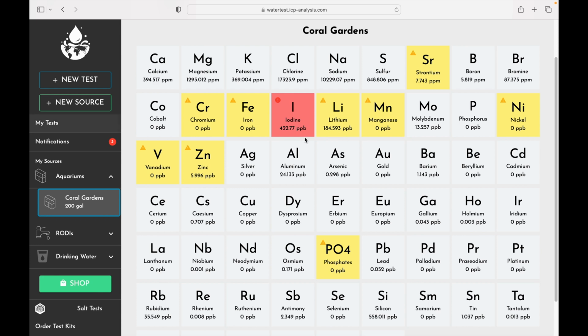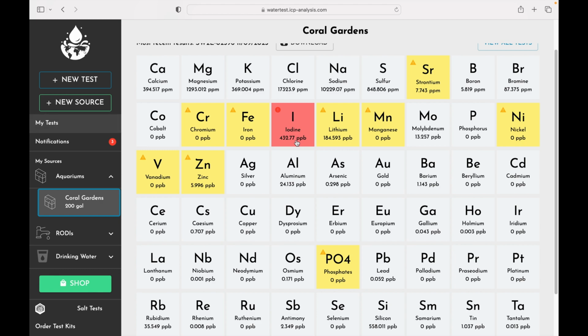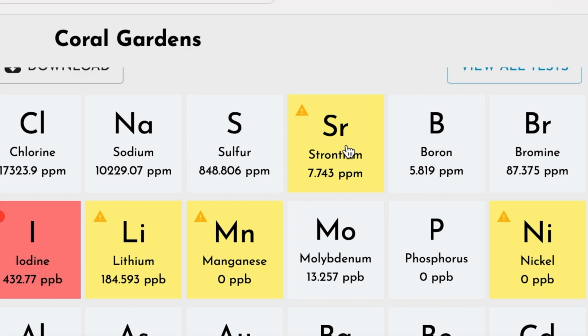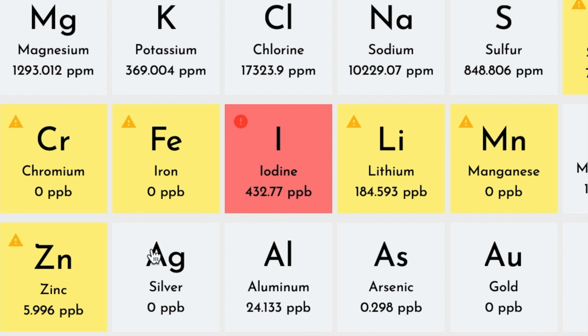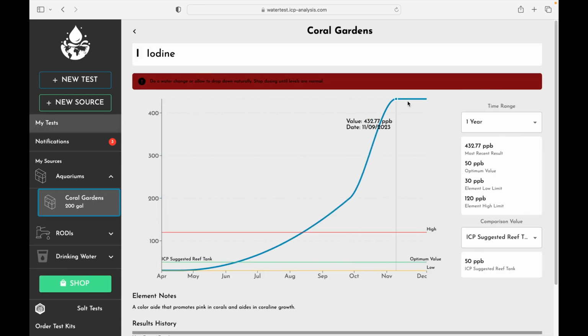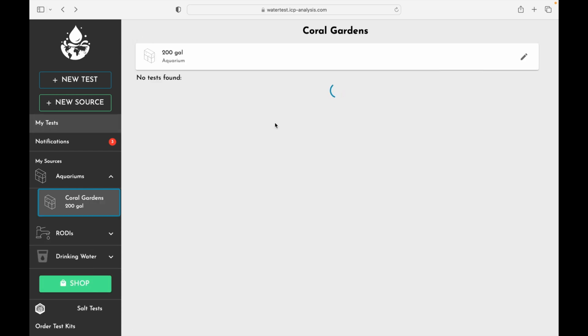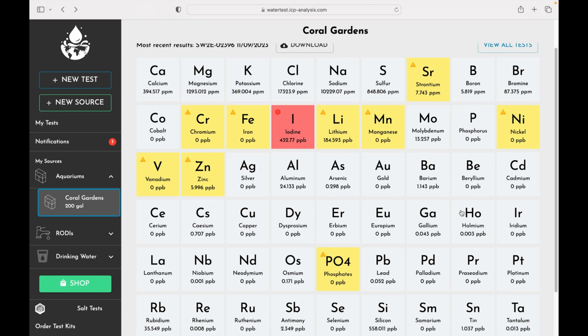Okay, ICP Analysis. Overall, the test looks pretty good. We got some yellow cautions and then one item here that's in red. So let's start at the beginning with the first one, strontium. It says it's low, which is fine. Iodine is high. Let's have a look at iodine. Iodine is super elevated. Manganese is 0. Nickel is 0. Phosphates are 0. They're probably close to 0. I don't think they're exactly 0, but it's reading 0.